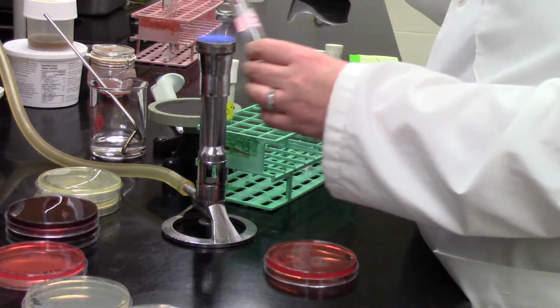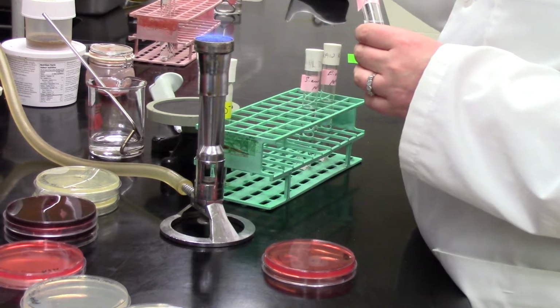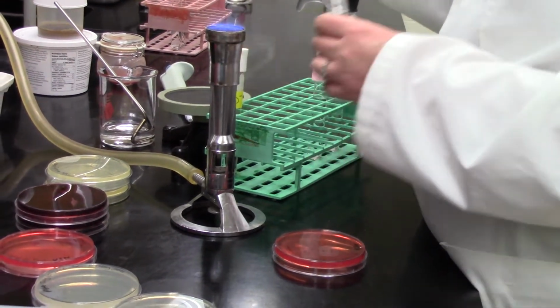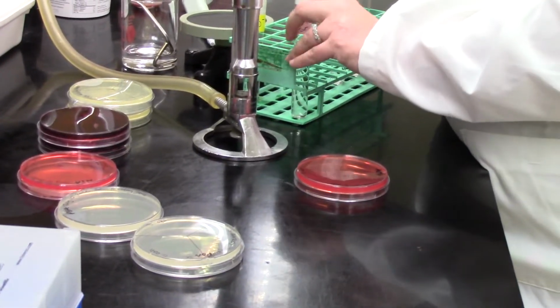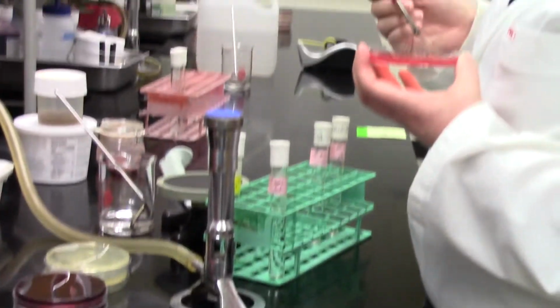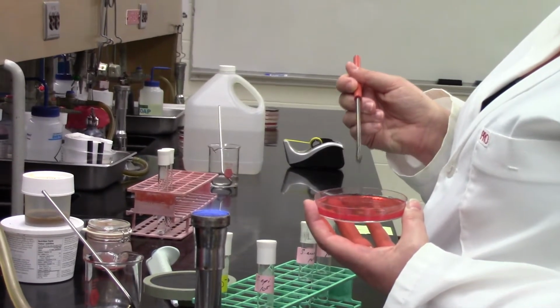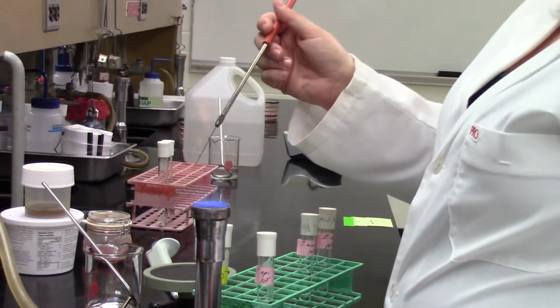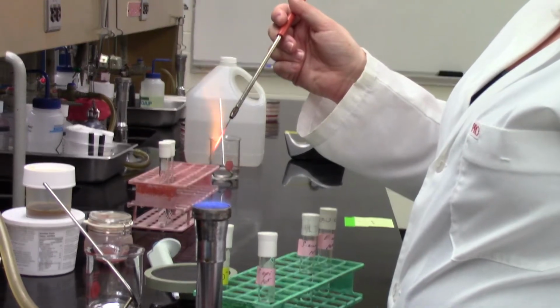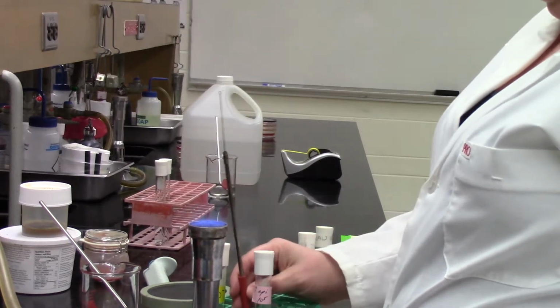We're going to use 3 bacteria on that plate instead of just having one type of bacteria on that plate. So she's going to work through all the media there. So the first plate she did was actually something called PEA, and this media is selective for... actually I'm going to stop myself because I'm not going to say. She's now going to inoculate staph epi, that's what she just did, now onto an MSA plate, or a mannitol salt agar plate. So that was the nice cherry red plate you just saw.